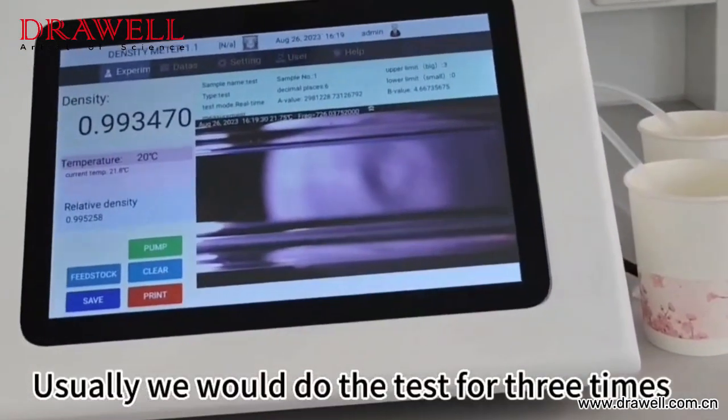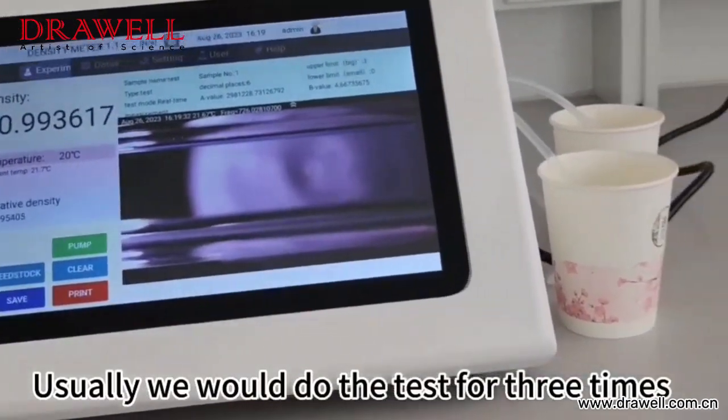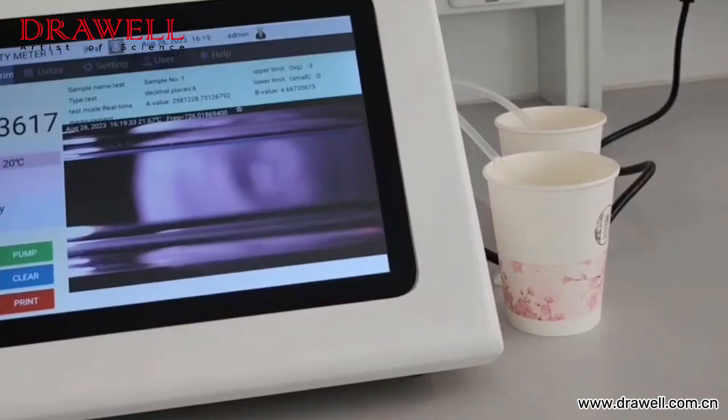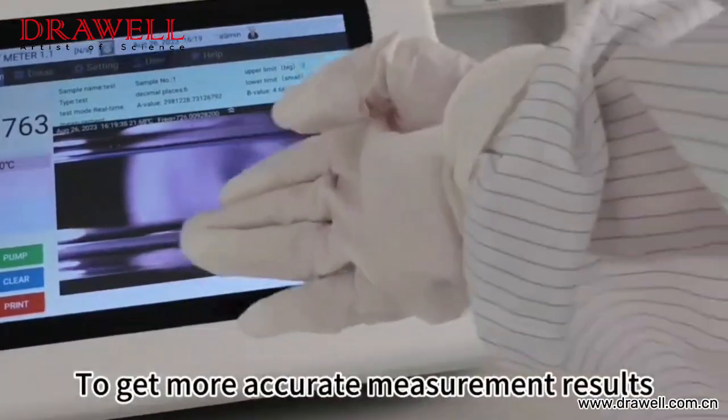Usually we would do the test three times to get more accurate measurement results.